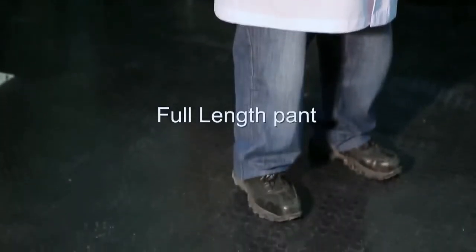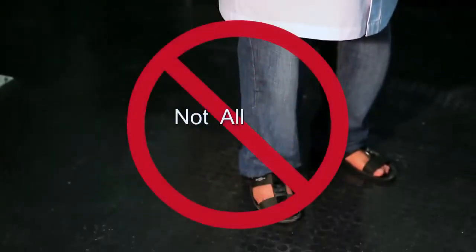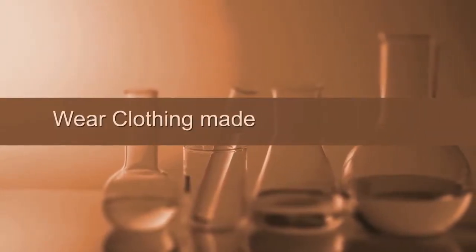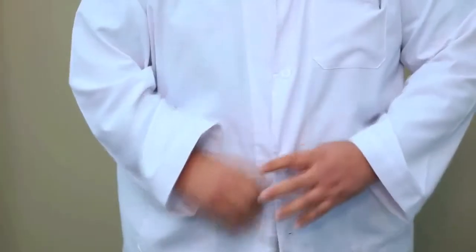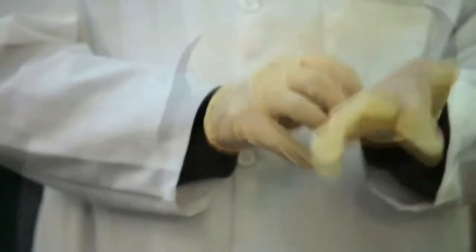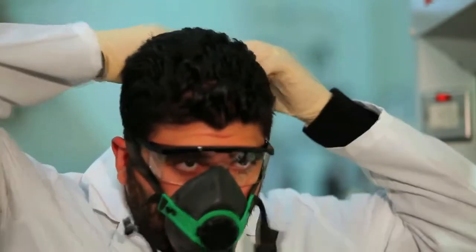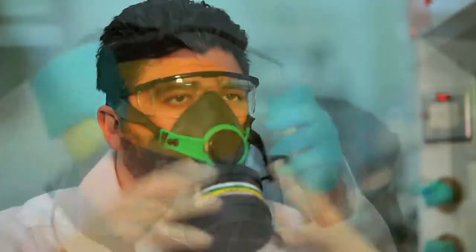This starts with your clothing. Anyone entering the laboratory must wear full-length pants and closed-toed shoes. No flip-flops or any other open-toed shoes are permitted. We also recommend that your clothing be made from natural fibres such as cotton, because these materials offer better protection in the event of a fire. A properly fitting lab coat, face and/or eye protection, and gloves of the correct size and type for the hazard involved are required. Other lab or hazard-specific PPE items may be necessary, such as respiratory or hearing protection.